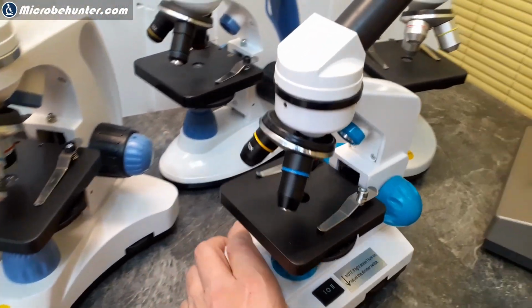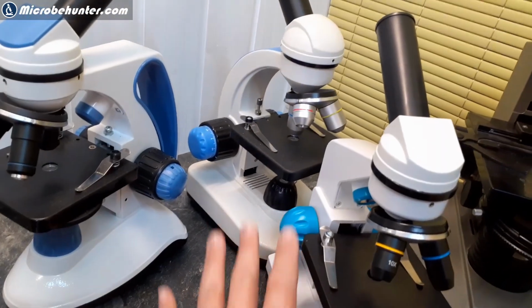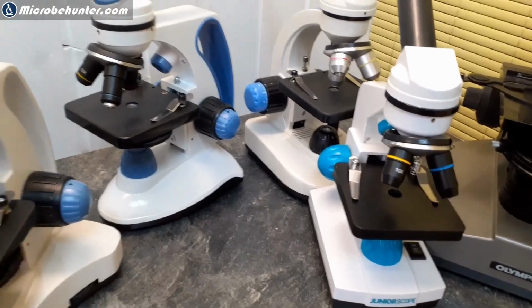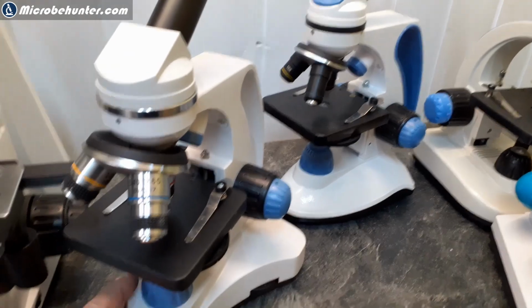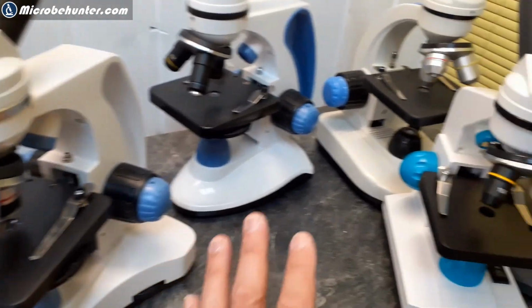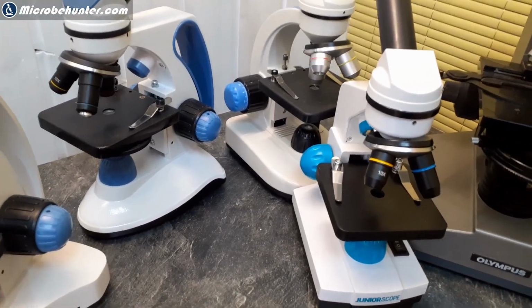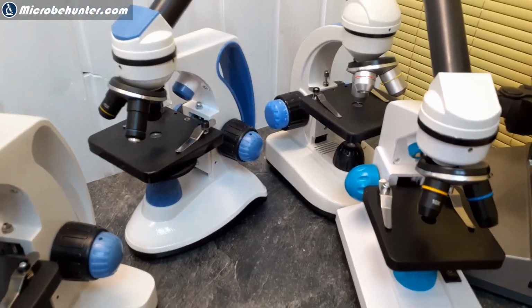And the reason is because some of those microscopes come along with a really high quality documentation. And this one really doesn't. So you see, there is this thing, what do you pay for? Sometimes you pay for the microscope, and sometimes they come with pretty good accessories and really good documentation, especially for children. This can be very useful. So this kind of compensates this a little bit.